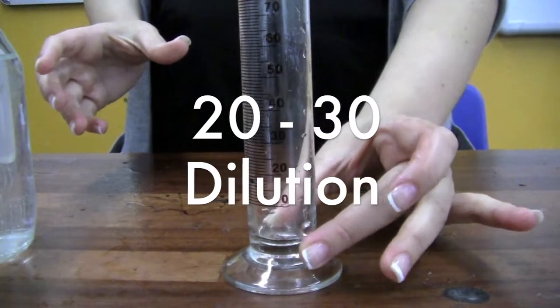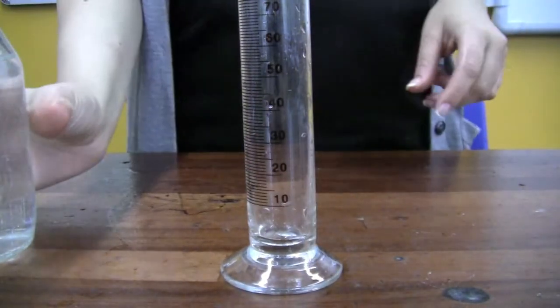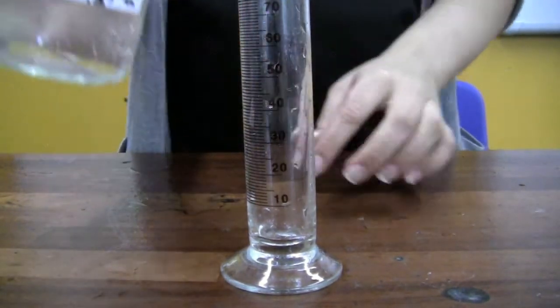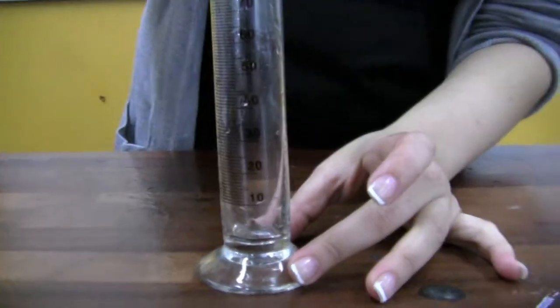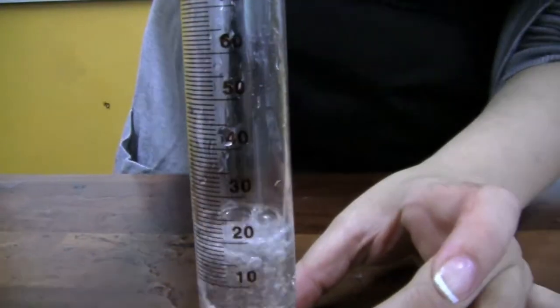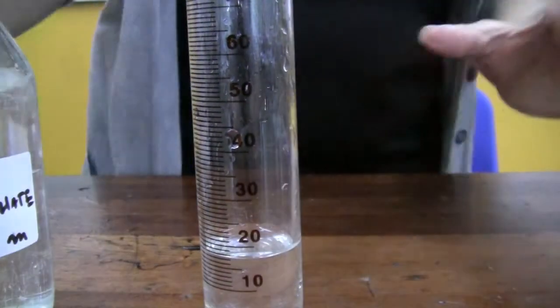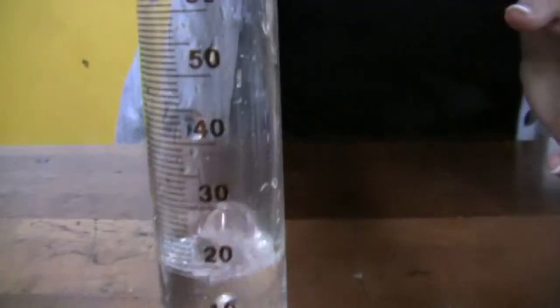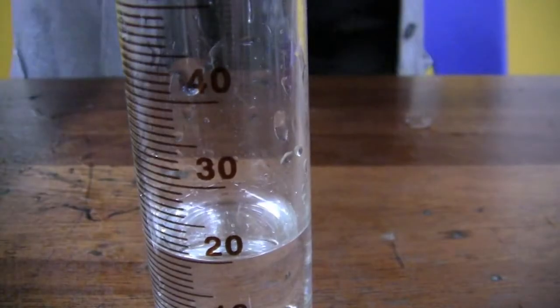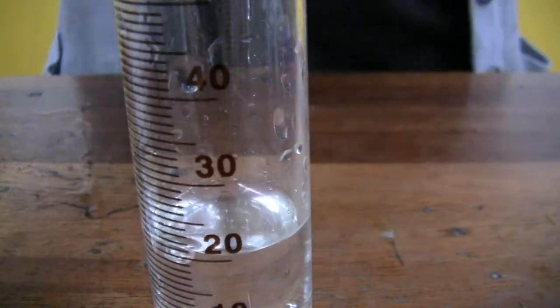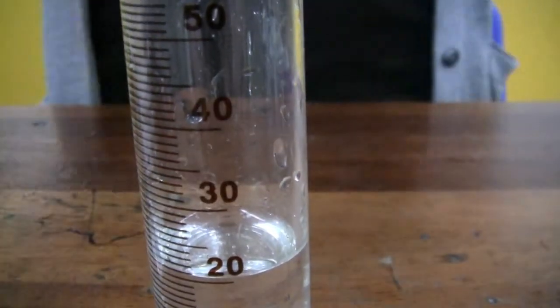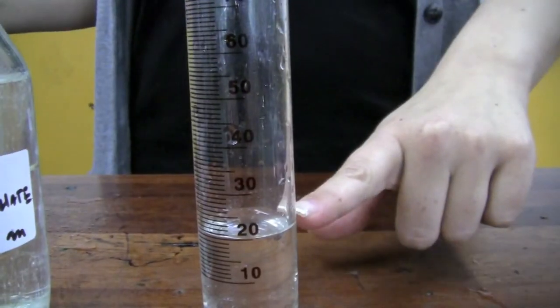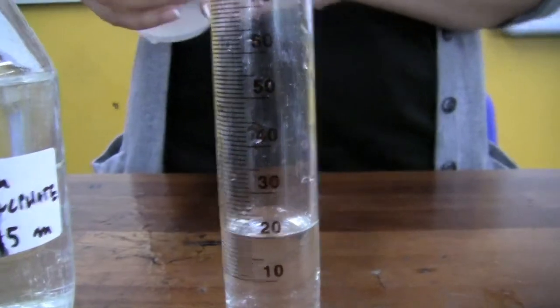For the fourth concentration, we're now going to start off by pouring in 20 ml of our sodium thiosulfate. And again, we finish off with the pipette to get it in the right place. So we've got 20 ml of sodium thiosulfate, now we need 30 ml of water.